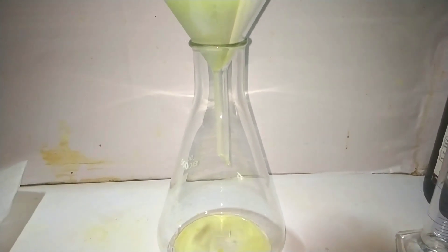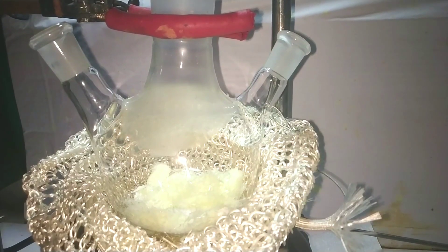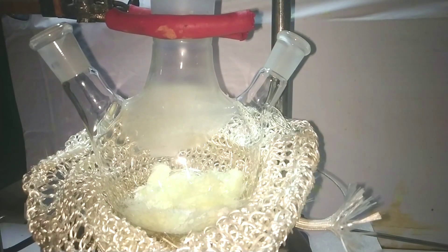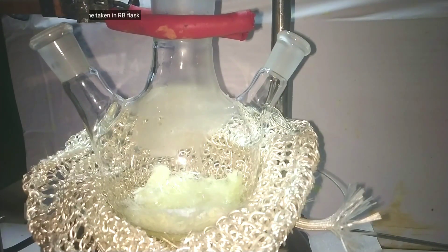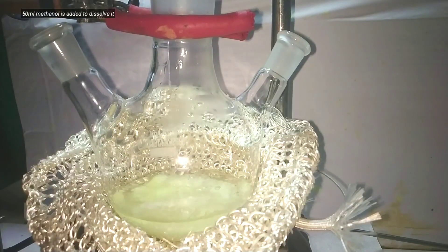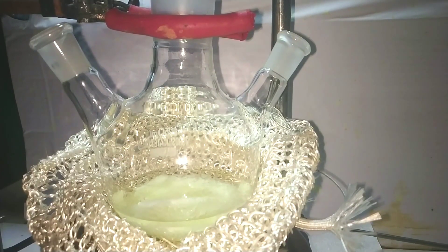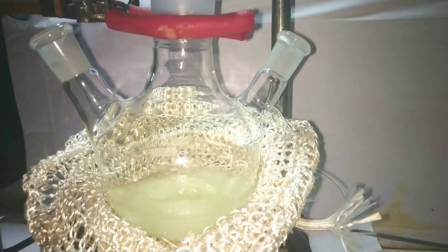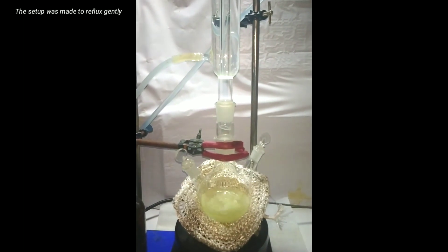This is going to selectively reduce the nitro group at the meta position. Start by taking a 250 ml round-bottom flask and attach it on a clamp on a hot plate. A heating mantle coil is provided to give uniform heat. 6.7 grams of 1,3-dinitrobenzene is added to the flask, and on top of that we add 50 ml of methyl alcohol and stir to dissolve it completely. Heating is also started to dissolve the compound. Once dissolved, a reflux condenser is attached on top of the flask and the contents are set to a gentle reflux.